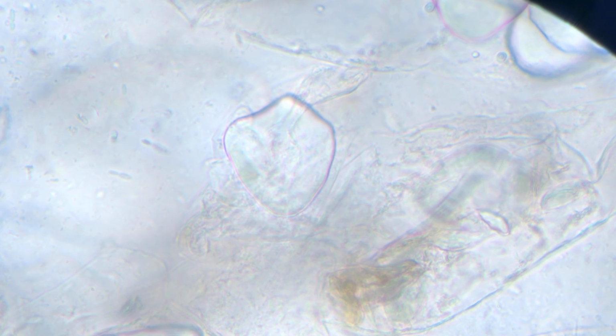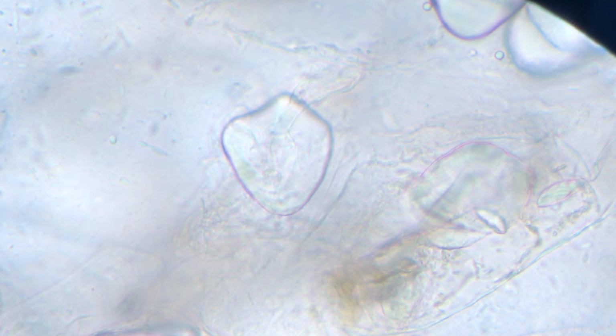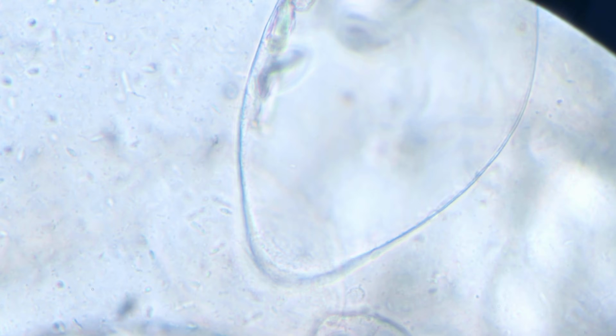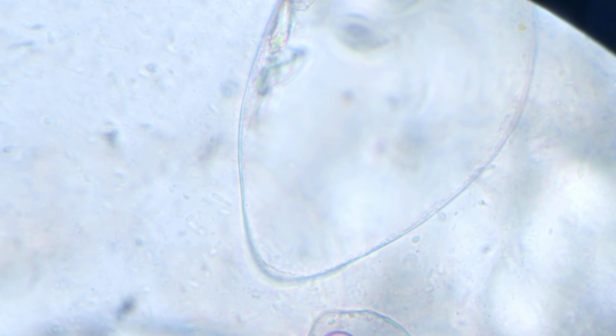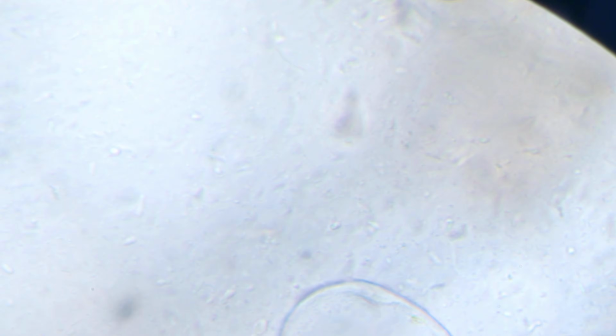And as usual, let's focus and see if we'll find any organism here, and I'll be surprised if we don't find any. Because this is clearly rotten, and sometimes I usually don't trust those overripe bananas. You might find that something is there eating it. So the goal is looking for anything that looks like a snake.